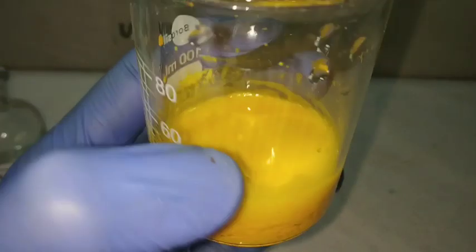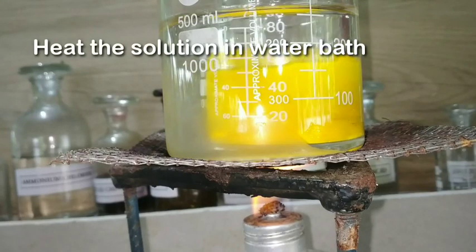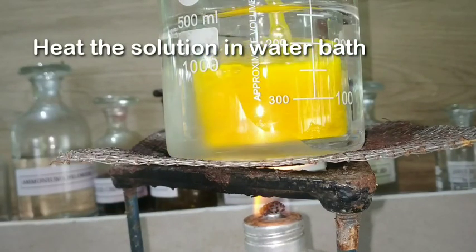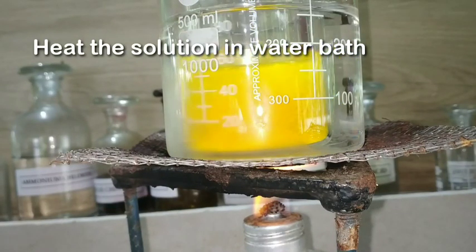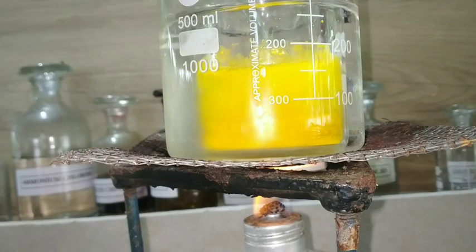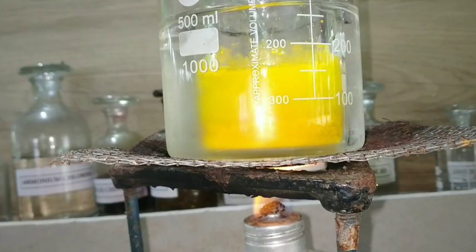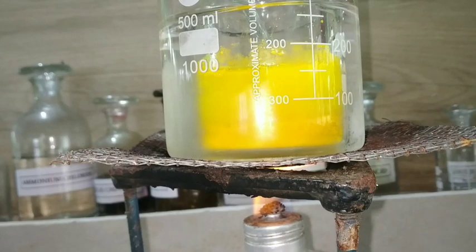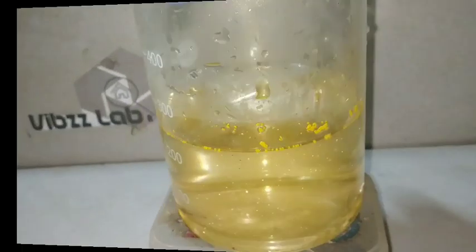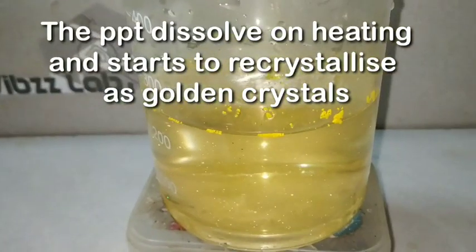Now we take this yellow precipitate and heat it in a water bath. On heating the solution, the precipitate gets dissolved giving a clear solution. Then on cooling, it will recrystallize out as golden yellow colored crystals, which you can see in the video.